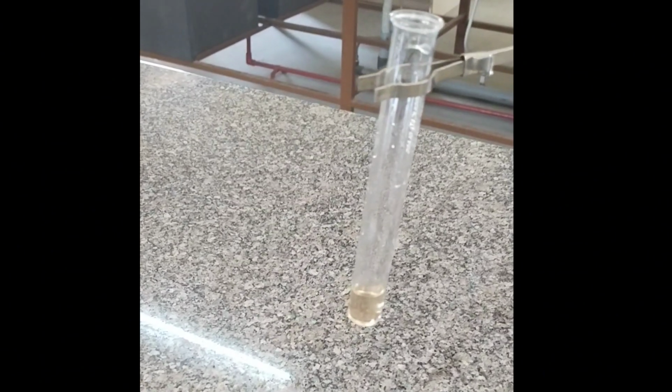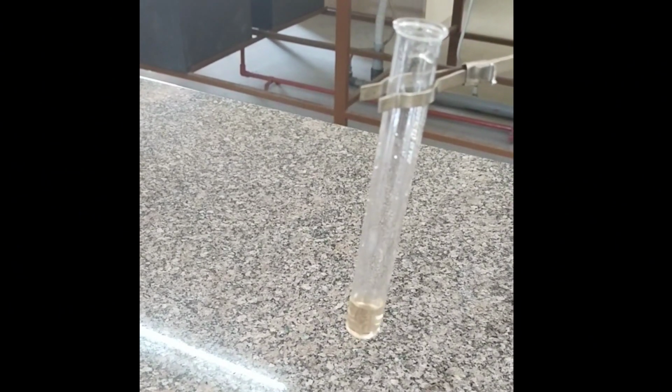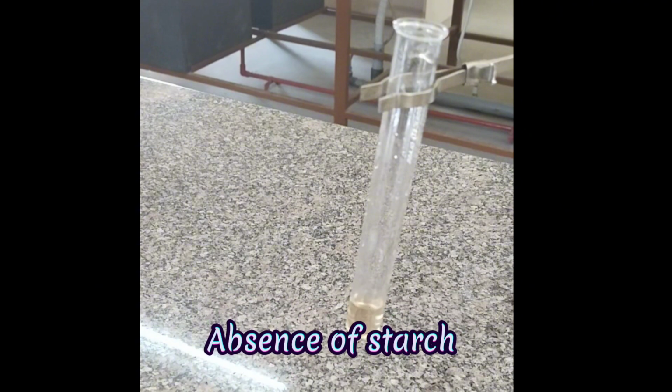Observation: blue color is not obtained. Inference: absence of starch.